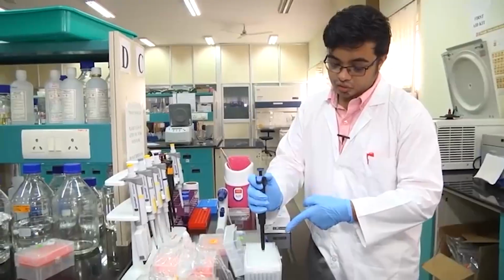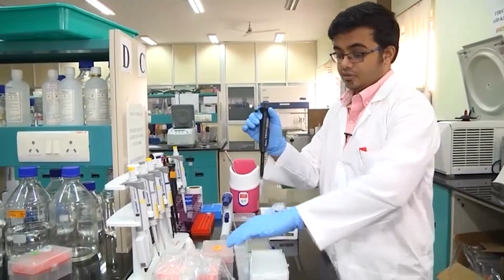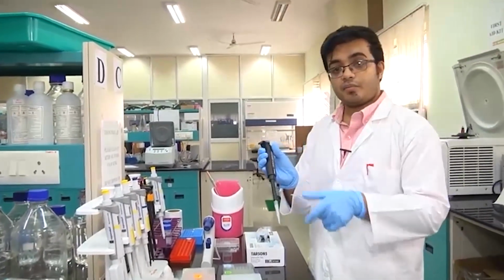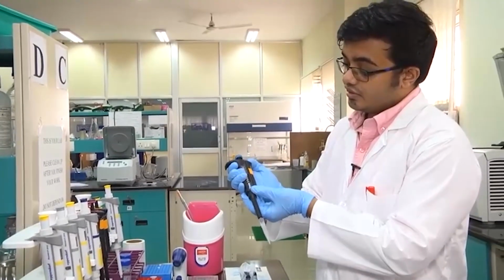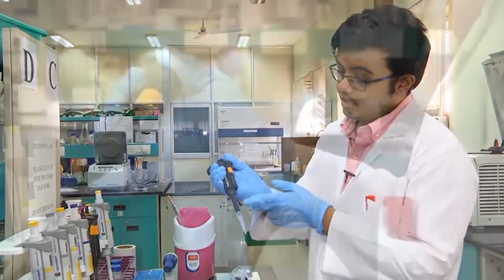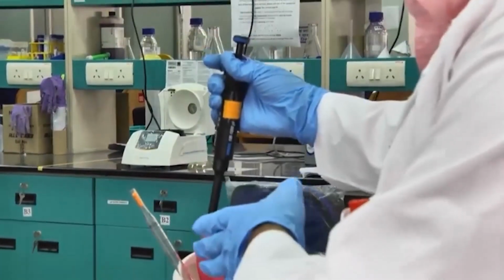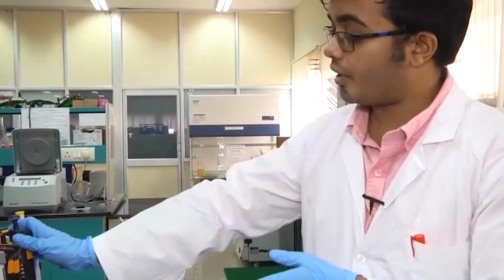So, I just showed you how to affix a pipette tip to the pipette. After using it, we need to detach this, which we call ejecting the pipette tip away from the pipette. It can be done very easily. You will notice that this region slides when I apply pressure, and as I apply pressure, this moves down. When I apply sufficient pressure, the pipette tip falls off. That is how we eject tips from pipettes.